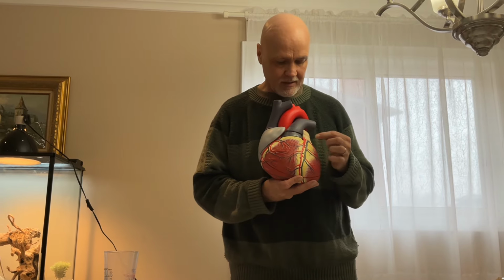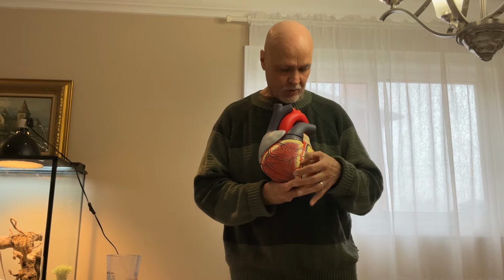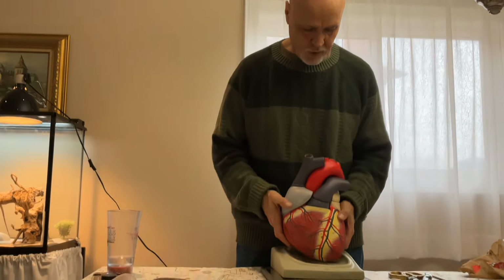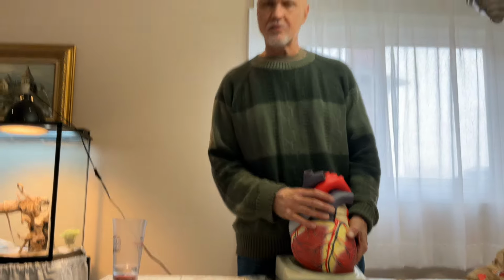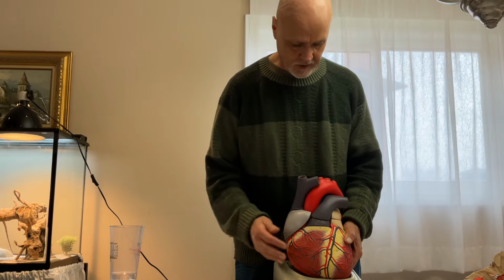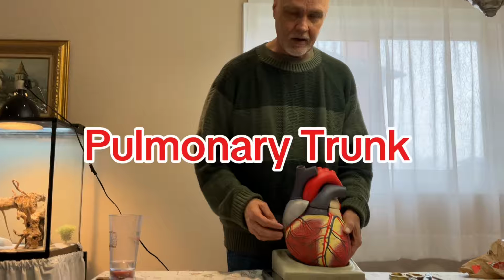But a coronary, as it's sometimes shortened to, is when one of these coronary arteries gets blocked or damaged. So now let's talk about the top part of the heart. This is the trunk, and the trunk is sometimes the base of a tree. It's also sometimes called the base of the heart. And this is the pulmonary trunk.